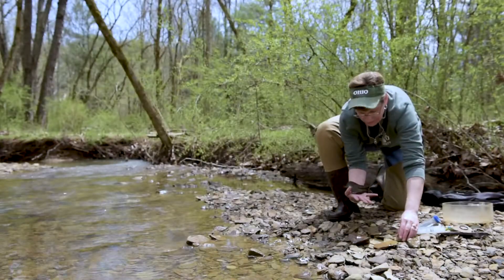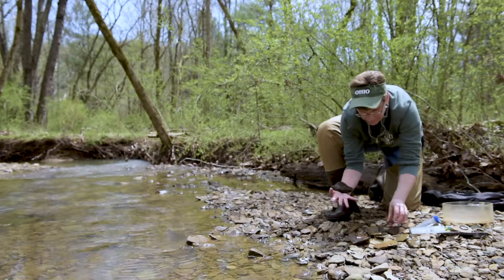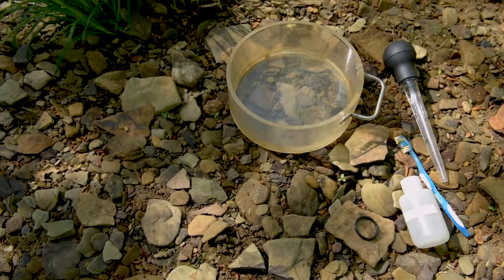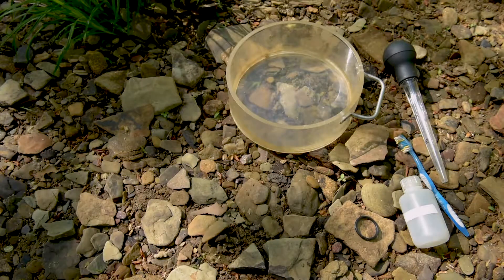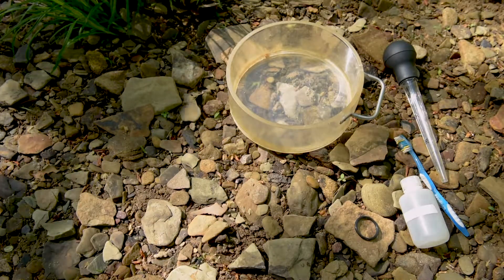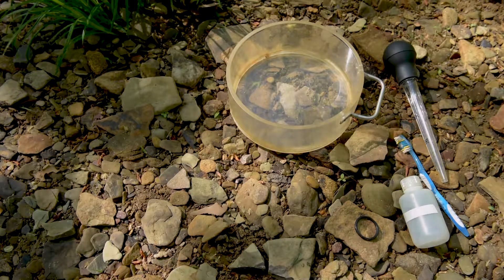Stream side, we will lay out the rocks and get to work. Our sampling equipment is simple: we have a view box or plastic container, an o-ring, a toothbrush, and either a syringe or a turkey baster.